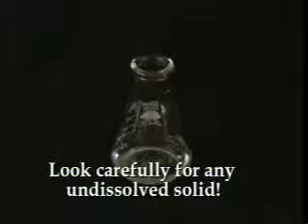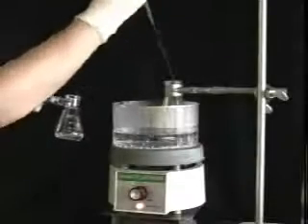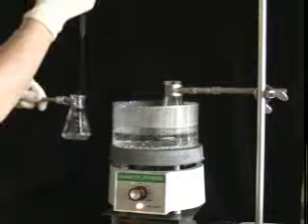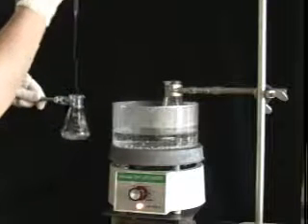If the solution is colorless, the decoloration step is unnecessary, but you still need to look carefully for any undissolved solid in the flask. If you find any, it can be removed by performing a hot gravity filtration with fluted filter paper. Vacuum filtrations cool the solution too much and crystals are lost on the filter paper and funnel. Before filtering your solution, add some excess solvent and heat it to the boiling point to ensure that the compound stays dissolved during the filtration.